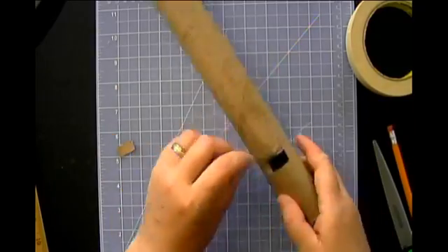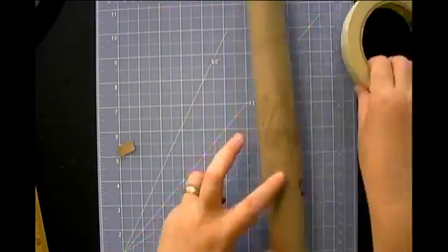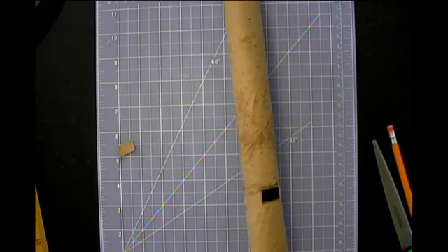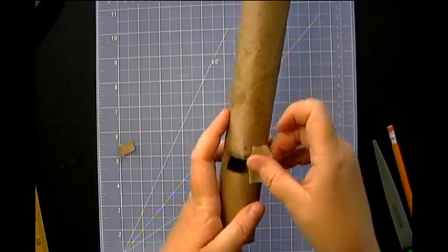Okay, so I've got myself a little tube here, a little viewing window, and like I said, I'm just going to take a bit of masking tape. I'm going to seal up the little spots where I cut a little bit too much. I was a little overzealous today.